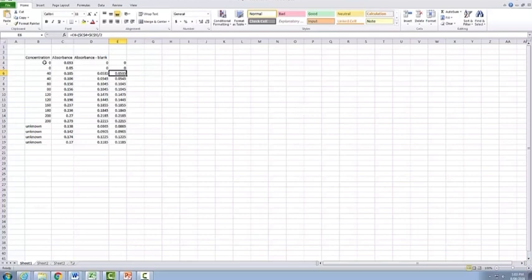So now that you actually have your concentration readings are correct and you've subtracted your blank from all your absorbance readings, you're ready to start drawing your graph. So what you need to do is highlight the actual cells here, hold down your control key, and then you also will highlight the absorbance readings as well.